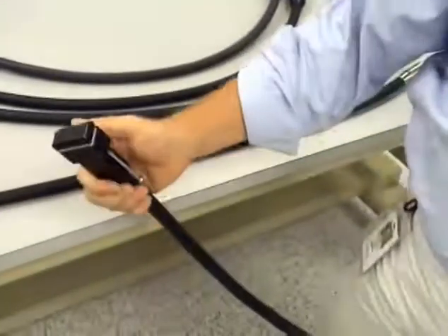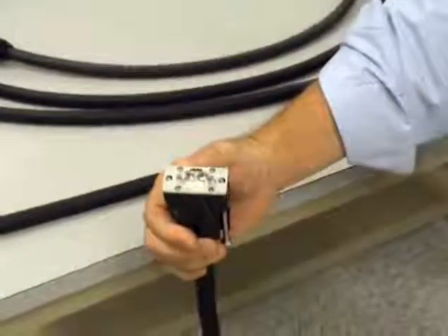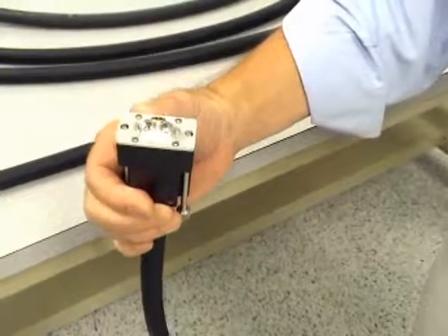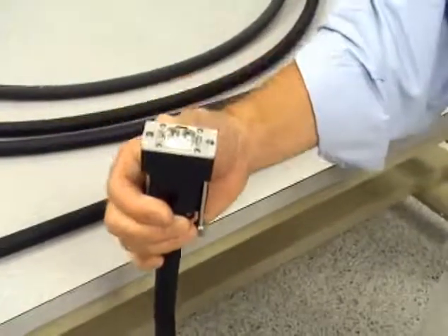There's a very clever little covering device here, which just slides off and locks like so. And you can see what it exposes here are two lenses that facilitate the transfer of the infrared energy from the instrument to the probe tip, and then from the probe tip back to the detector in the instrument.